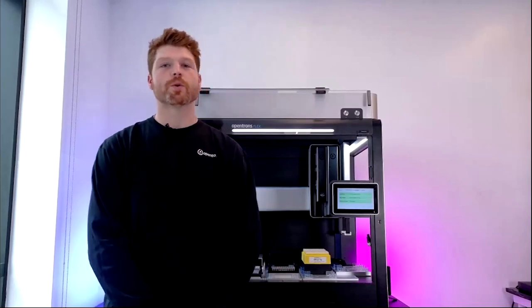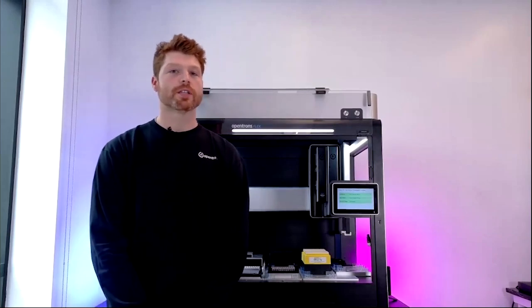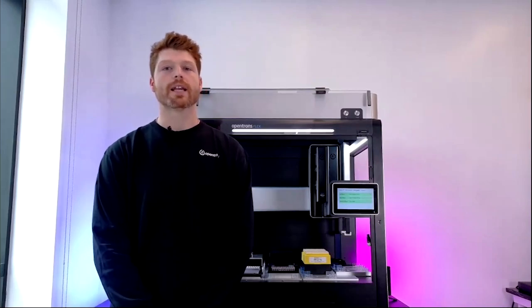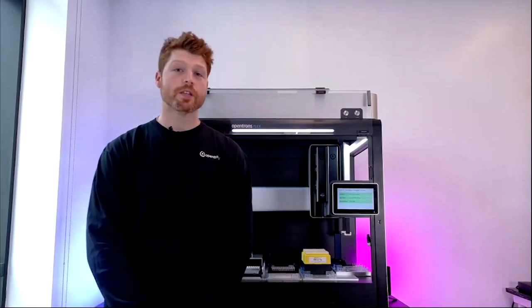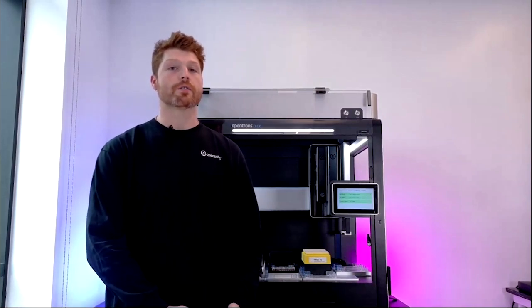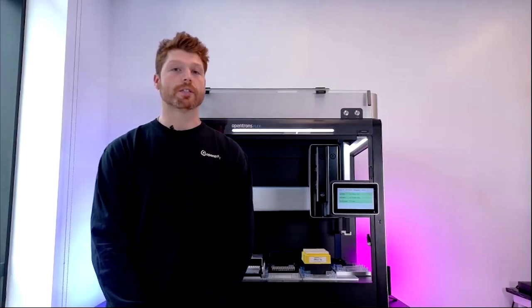First, I want to give an overview of the different ways that you can create protocols for your workflows on the Flex. As Fran mentioned, an FAS from the Opentrons team can provide on-site application development and optimization. It's great to have them working there with you. We also offer remote protocol development and optimization. And you have the option to write protocols yourself, either through our Python API or through one of our UI-driven tools, such as Protocol Designer.